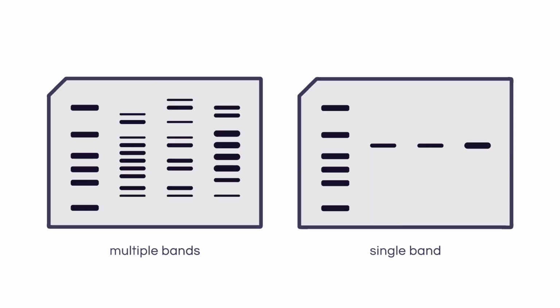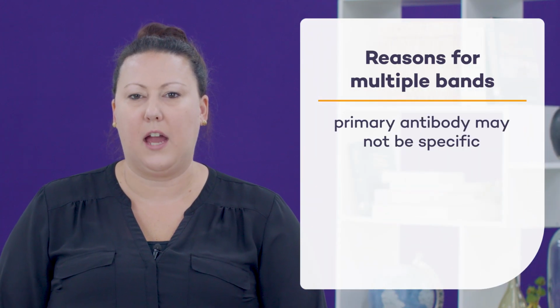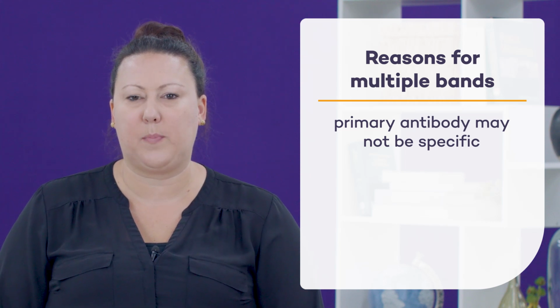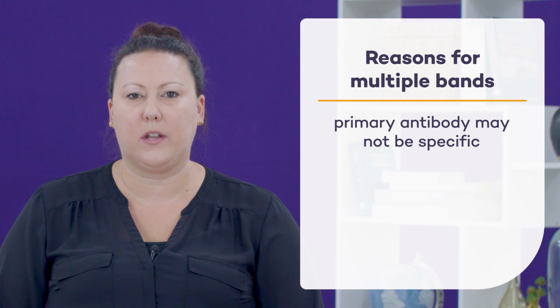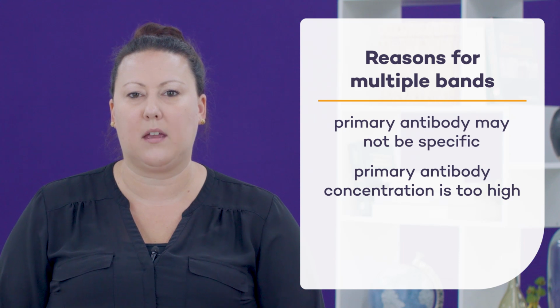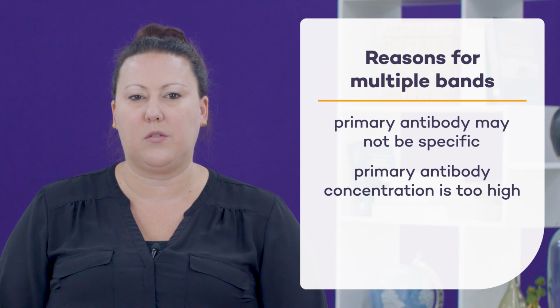A fifth issue that is frequently observed during Western blotting is the presence of multiple bands on the membrane rather than a single band. There can be several reasons for this. First, the primary antibody may not be specific for only your target of interest under your specific assay conditions. Make sure to validate any antibody for specificity prior to using it in your Western blot protocol. Another reason you may be seeing multiple bands is that the primary antibody concentration is too high. Try decreasing the concentration of the primary antibody to alleviate these issues.